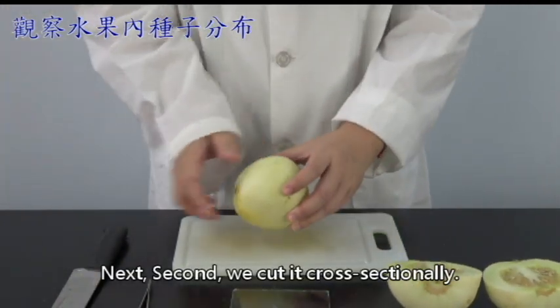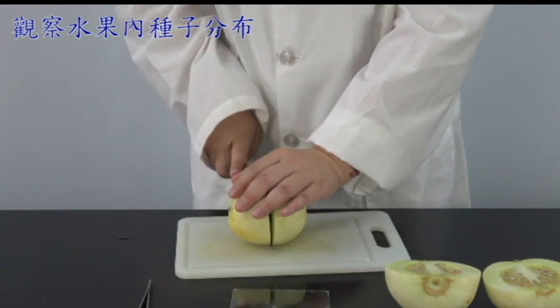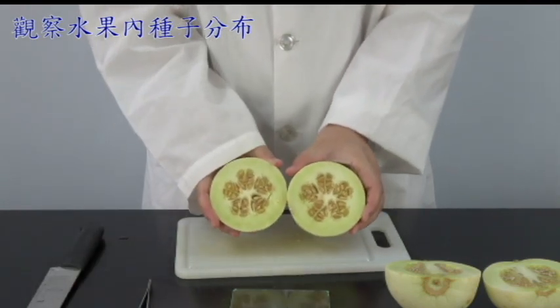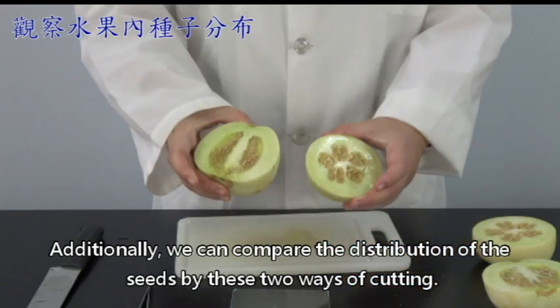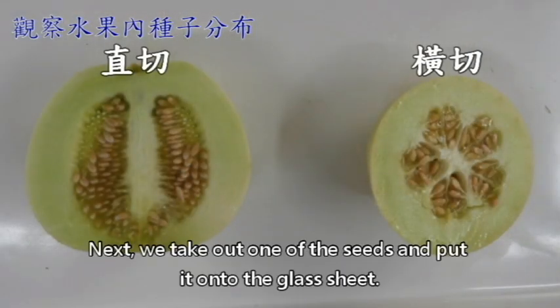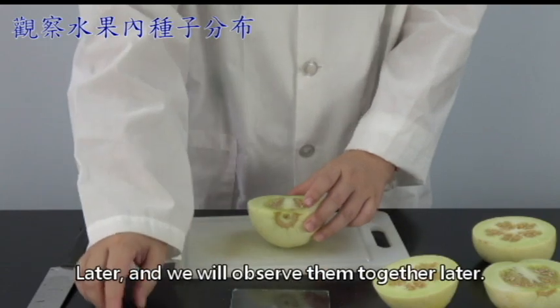Next, second, we cut it cross-sectionally. After placing the Oriental melon sideways and cutting it, we can see the distribution of the seeds. Additionally, we can compare the distribution of the seeds by these two ways of cutting. Next, we take out one of the seeds and put it onto the glass sheet. We will observe them together later.